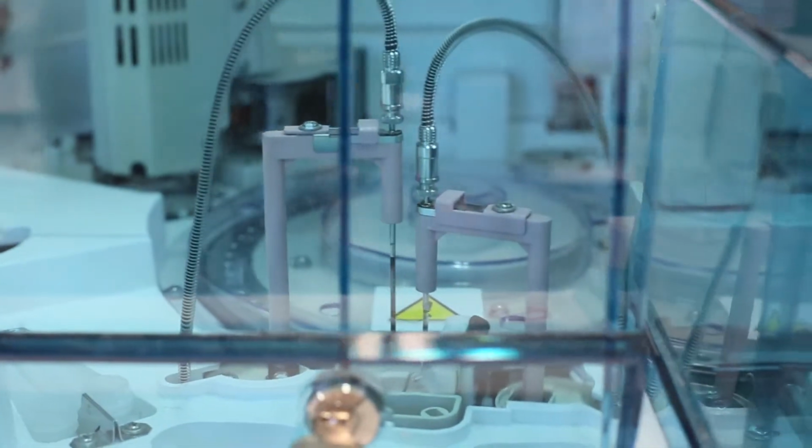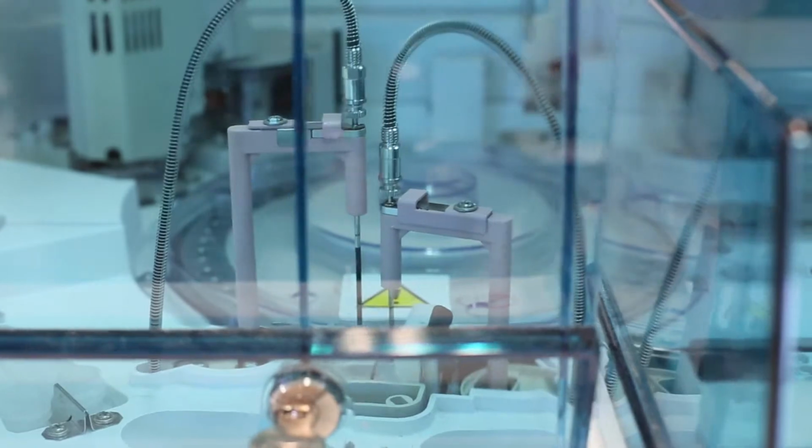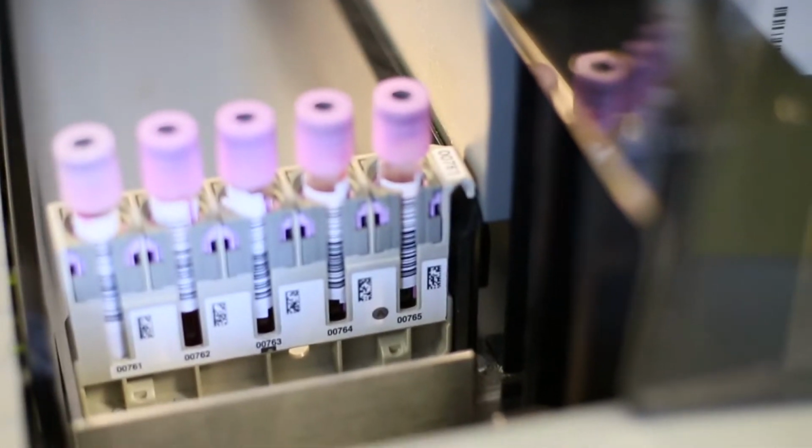As you've been through the department, you've seen that for blood sciences especially, we have very large platforms of analysers, and it's not really easy to have an analyser next to a PC or to have PCs around the analysers that we actually have. So therefore, the reason that we went for the iPad is because when we're doing things like maintenance or doing specific duties by these big platforms, they can actually have the iPad with them.